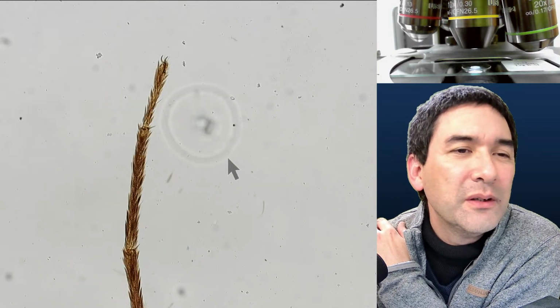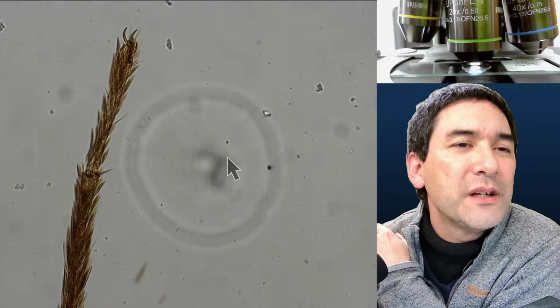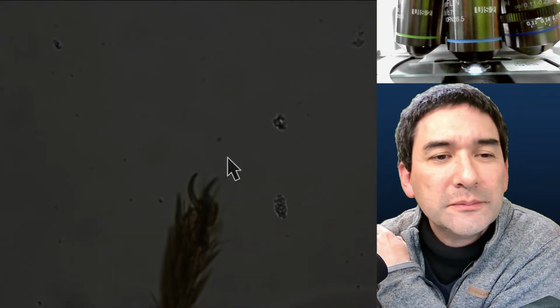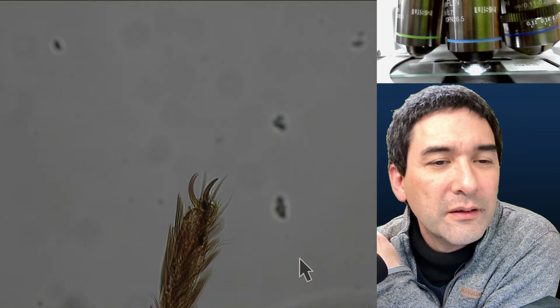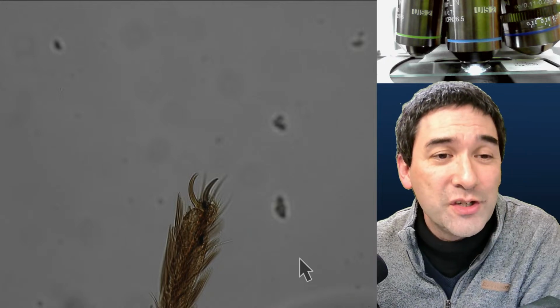Does this have a claw? I mean, mosquitoes are able to sit also on walls and everywhere, so there might be a tiny claw over here as well. Yes, here it is. You see, almost those two finger-like extensions here.